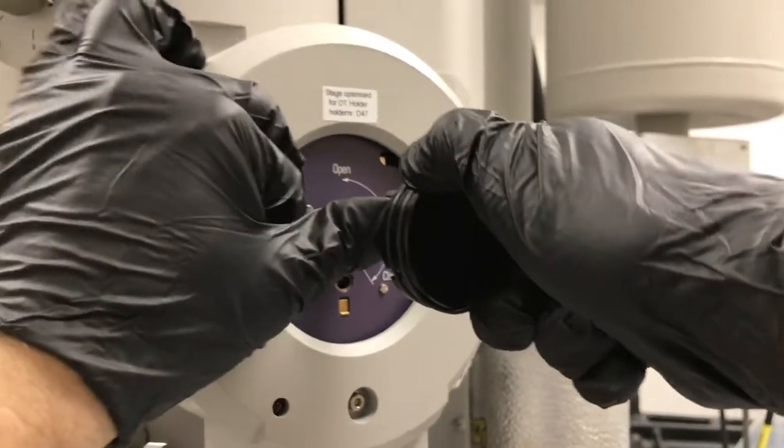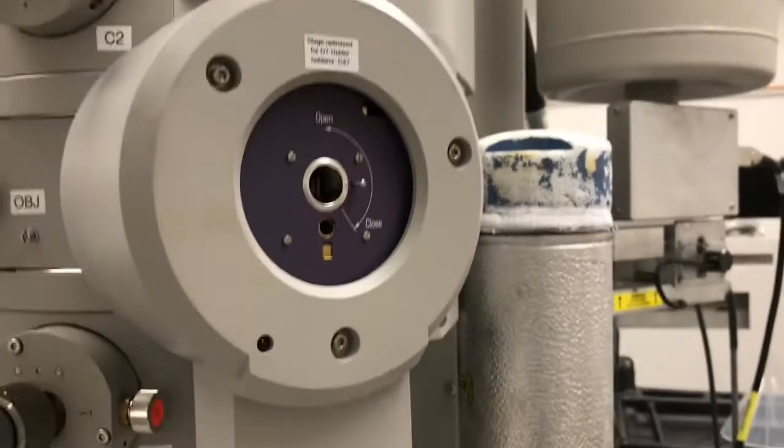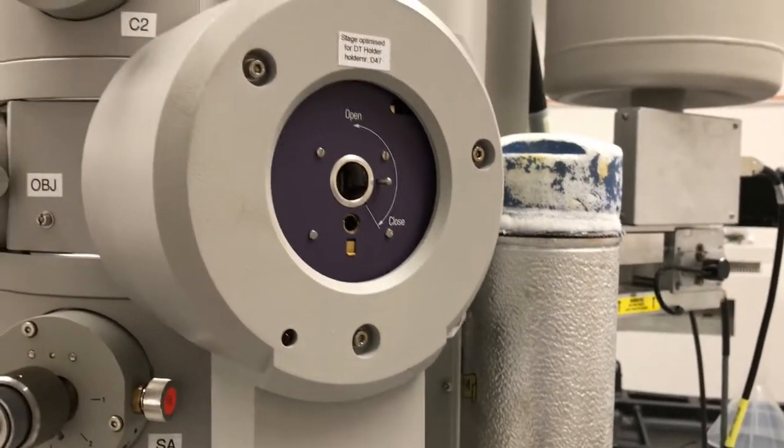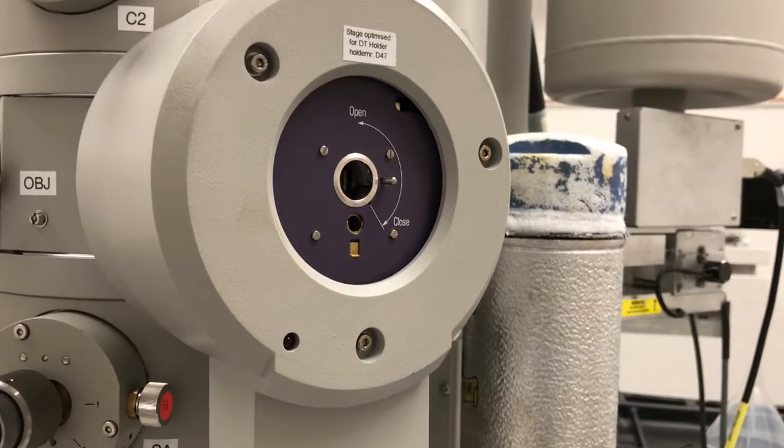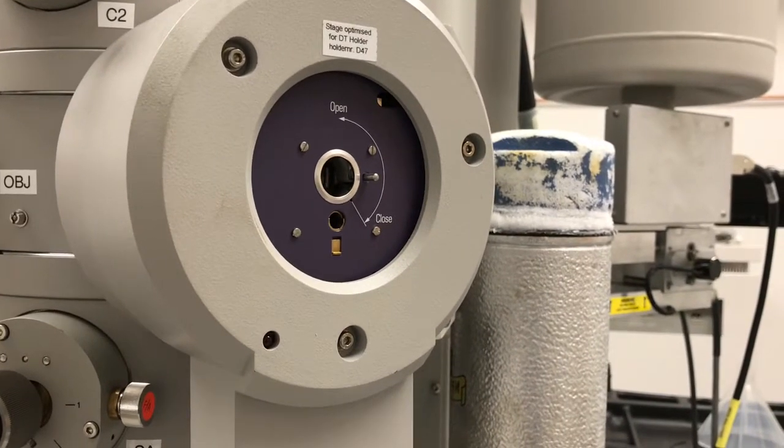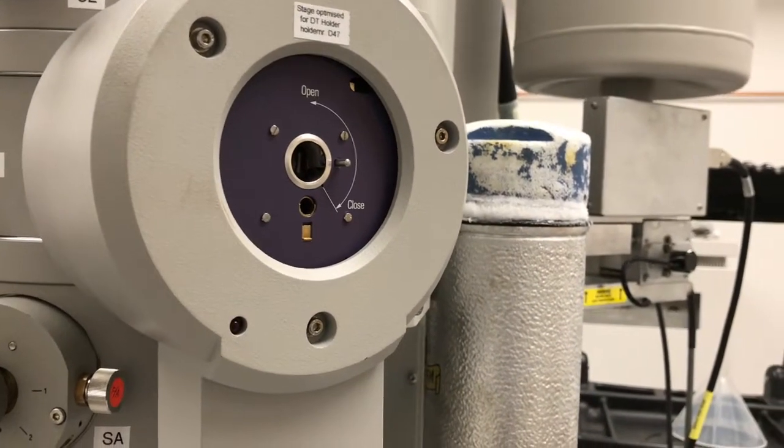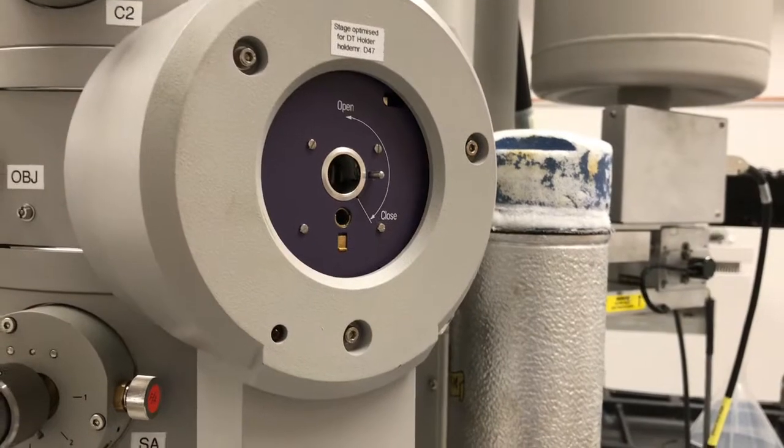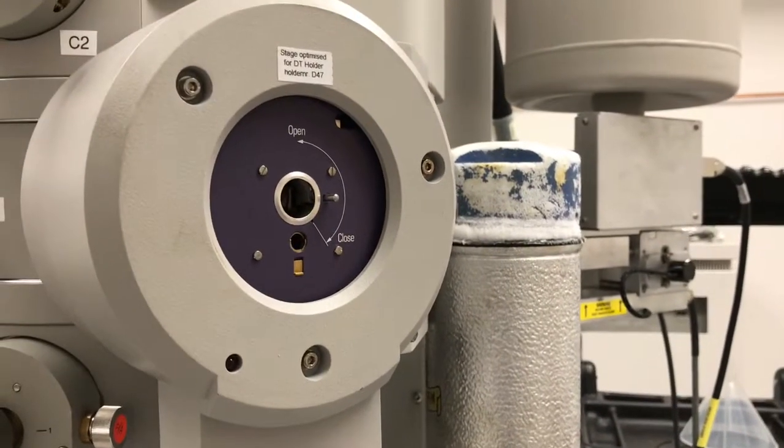There's the stop. Take your left thumb, put it behind the base and pull straight out while you're also pushing with your thumb from the left hand. And so that went off perfectly, no problems. And so now we can talk about insertion.